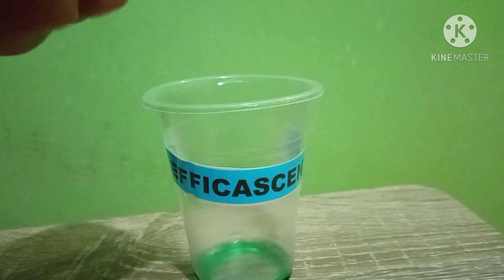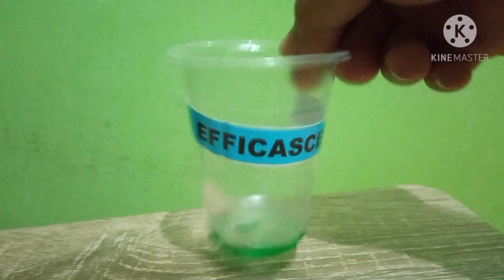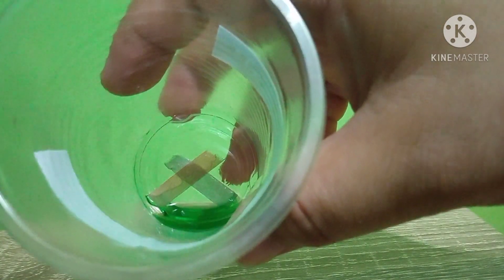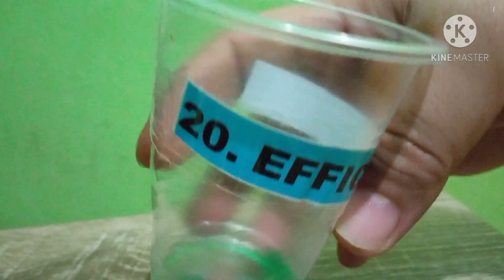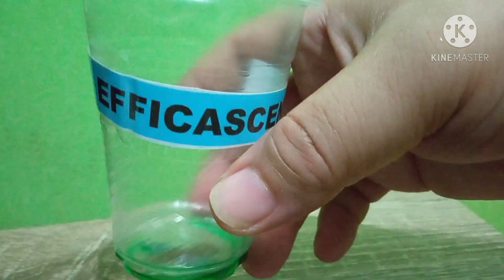Next is Efficascent Oil. Let's dip both litmus papers. The red one is gradually turning blue. So Efficascent Oil is basic.